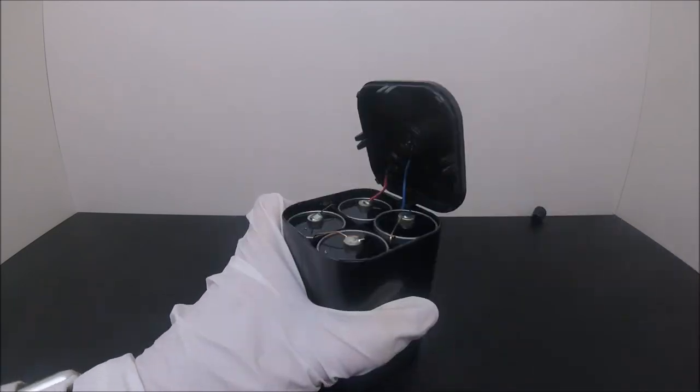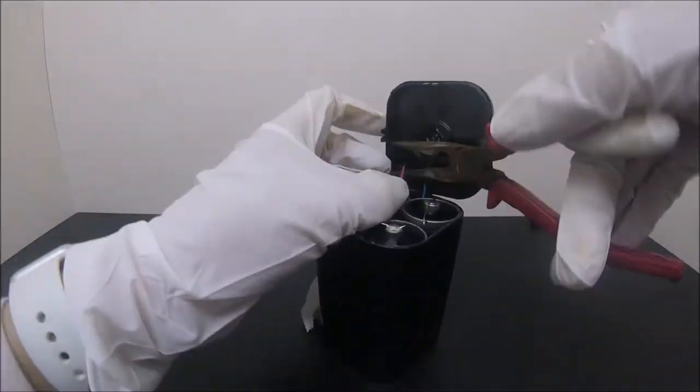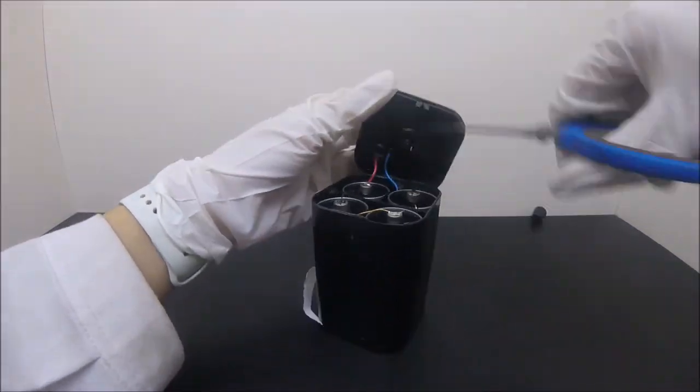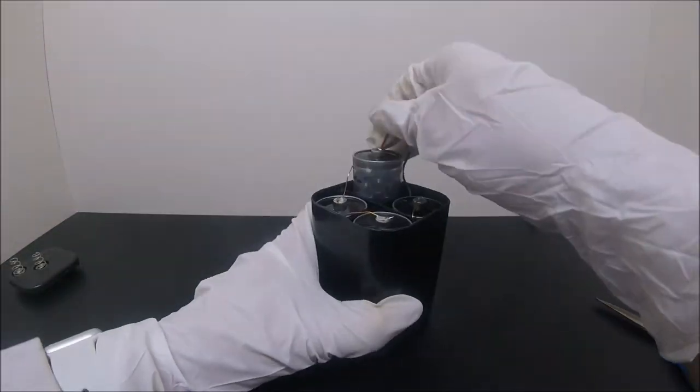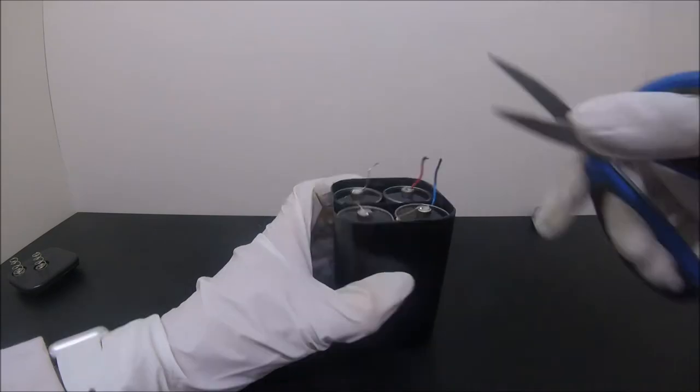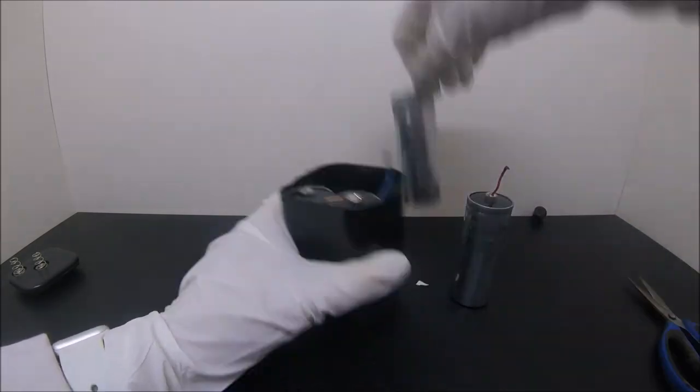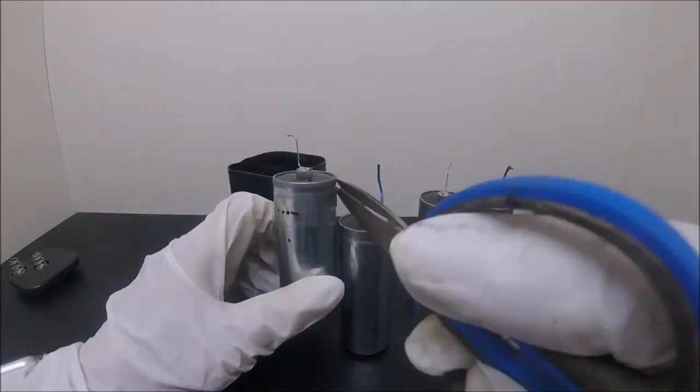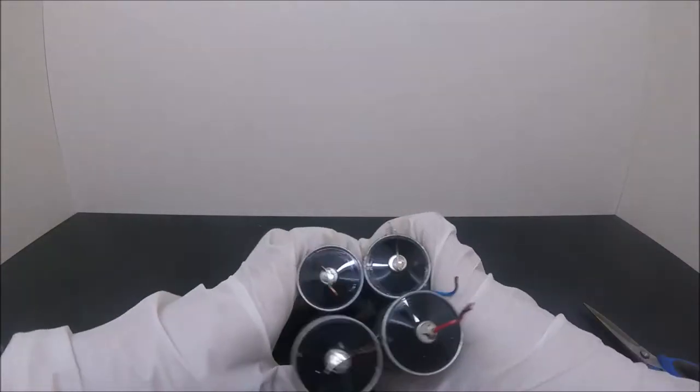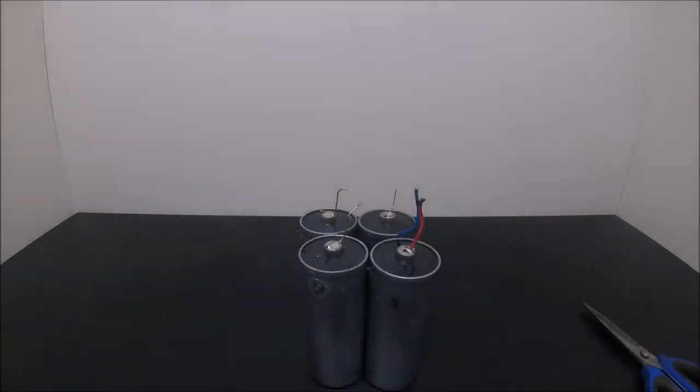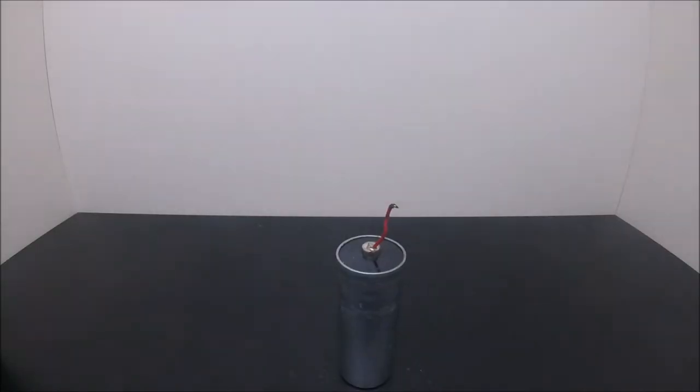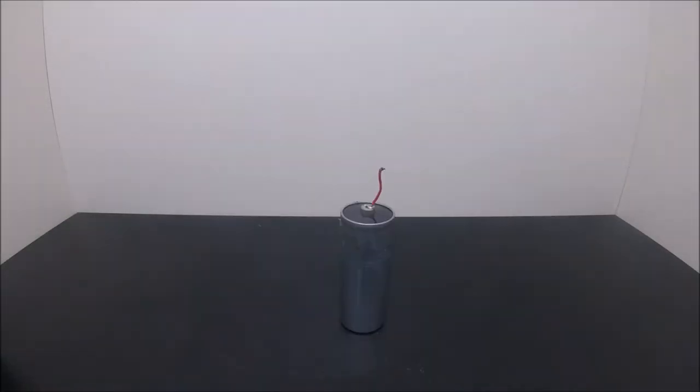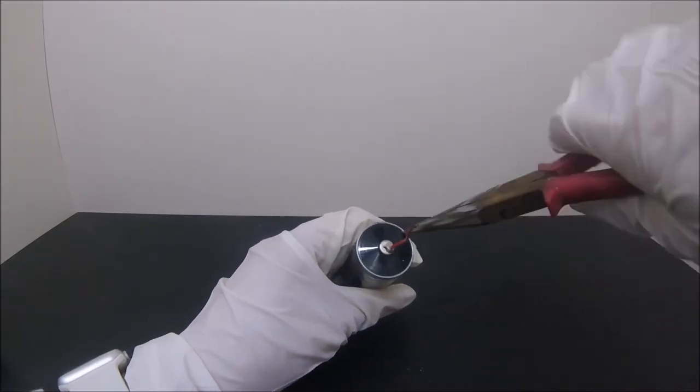By using a pair of scissors, cut the wire in your favorite color first. Since we're not disabling a bomb or something, the orders don't really matter. So here are all four cells, but I'm just gonna do one. Because I don't need that much, and I'm very lazy.